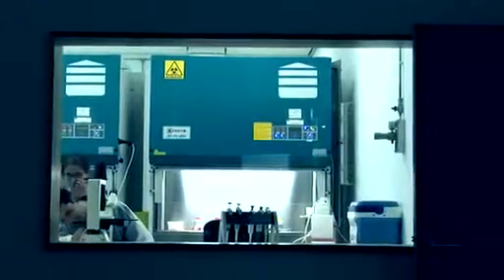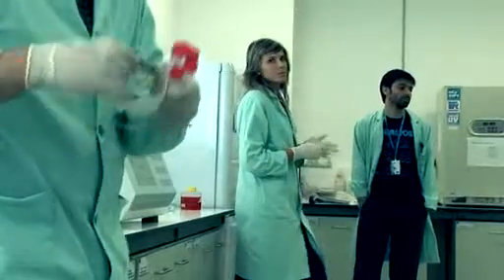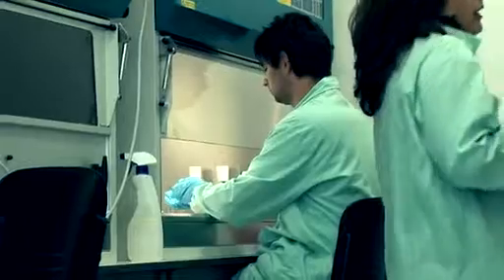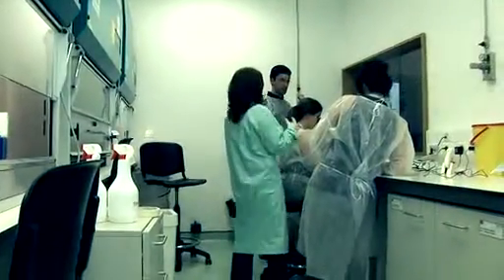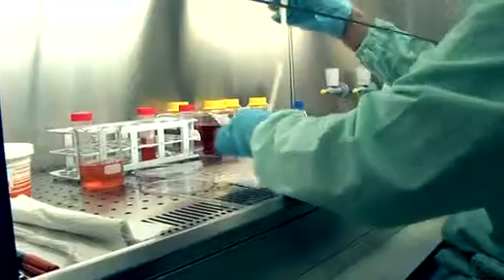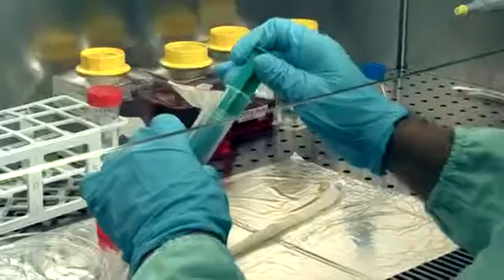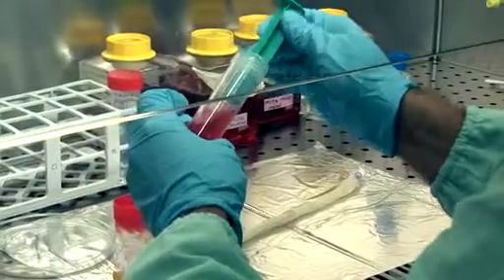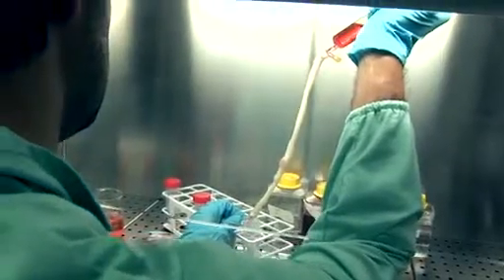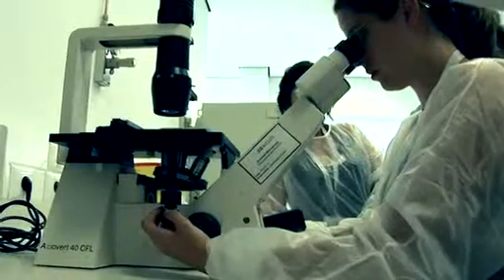All the experiments involving cell lines, primary cells and/or stem cells after isolation from different sources are performed in the cell culture laboratory, from basic research to tissue engineering studies using the different materials developed in the group. The Cell Culture Lab is equipped with all the standard cell culture equipment, including 6 biohazard laminar flow chambers, 4 CO2 incubators, an inverted light microscope and 2 centrifuges.